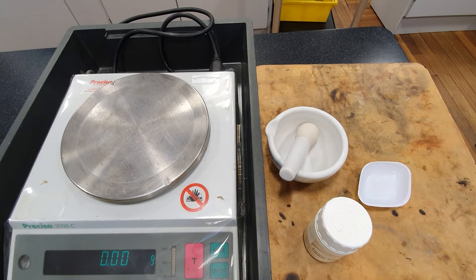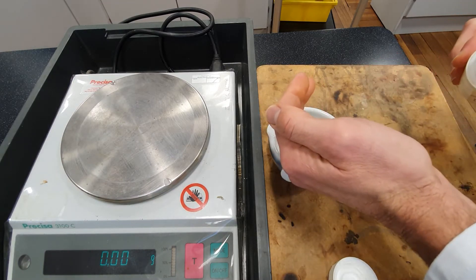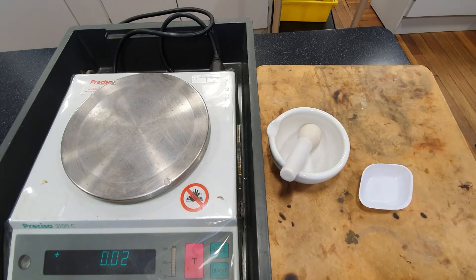Step 1, crush an iron tablet in a pestle and mortar.